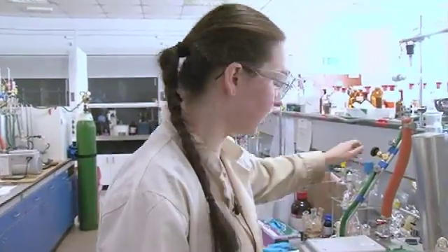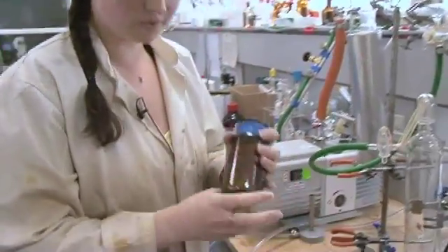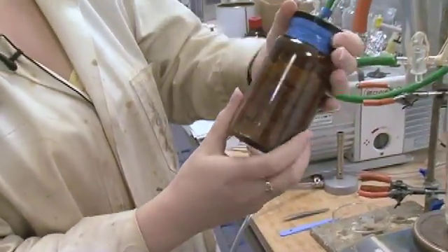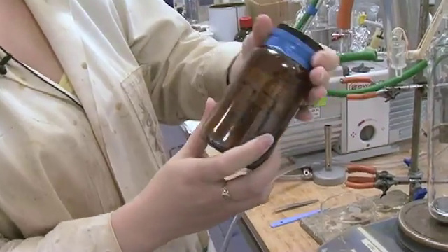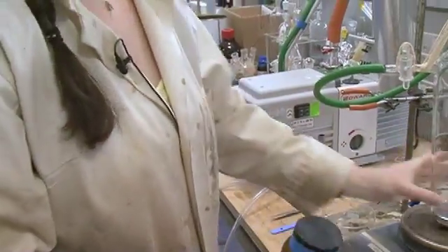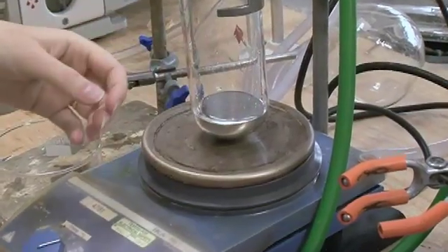So what we're going to do today is we're going to take sodium. So this is our sodium. As you can see, it's stored under liquid paraffin. And this is our mercury here. So we're going to dissolve sodium up in mercury.